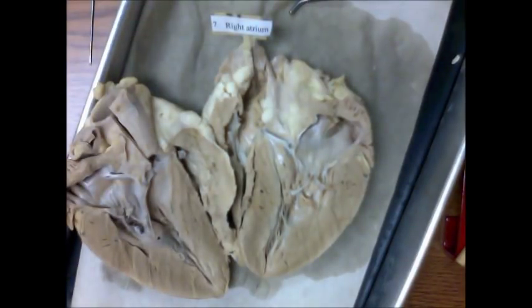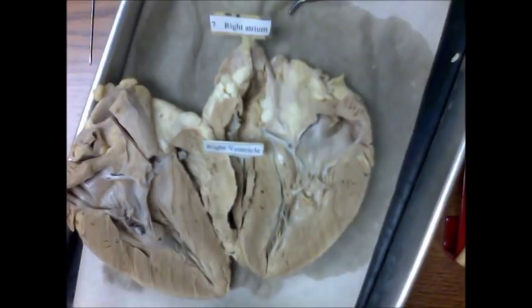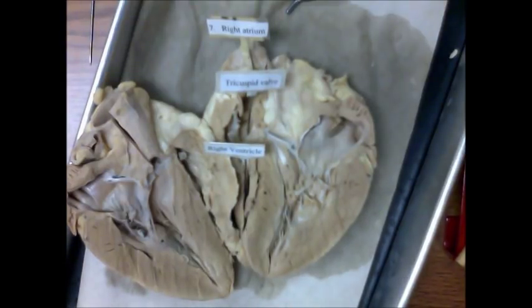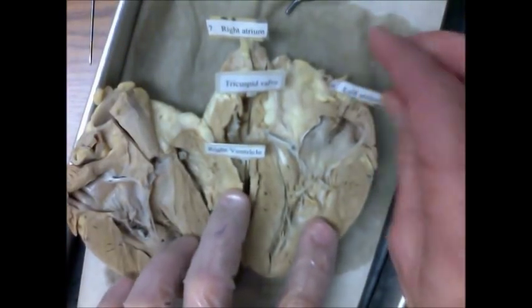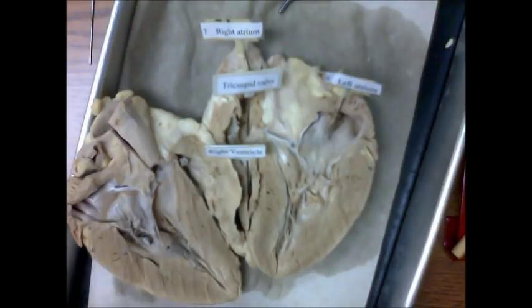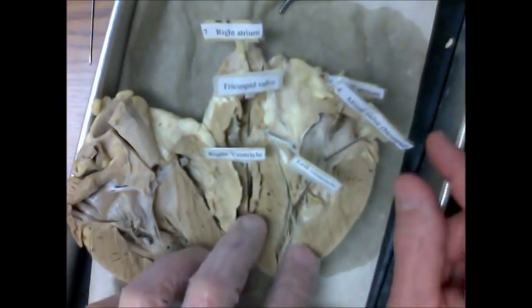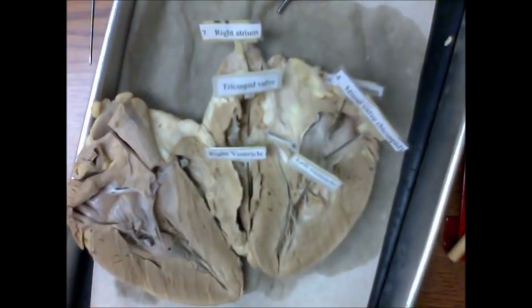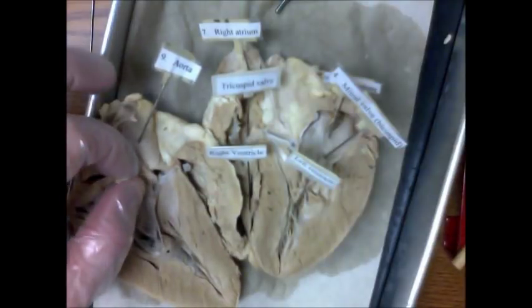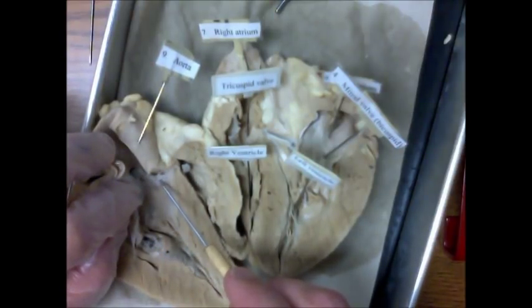Reviewing the major landmarks: right atrium, right ventricle, tricuspid valve on the right side of the heart, left atrium, left ventricle, bicuspid valve — also known as the mitral valve — on the left side of the heart. Here's the aorta, and at the base of the aorta you can see the very thin but strong aortic semilunar valves.